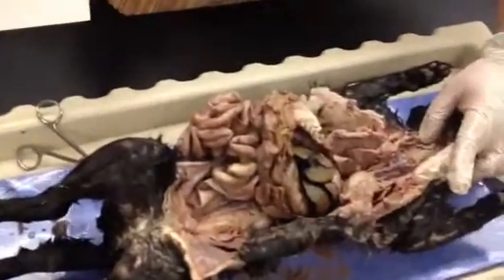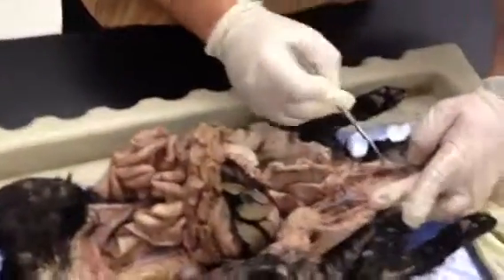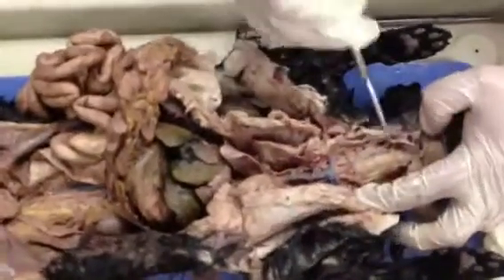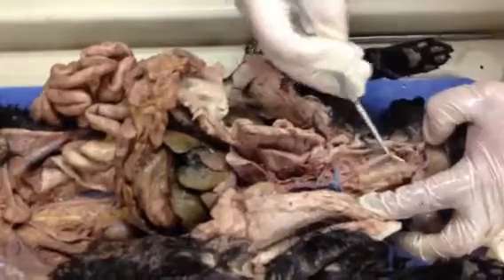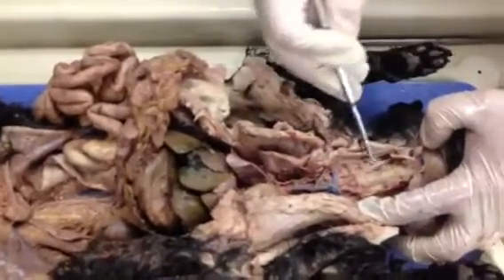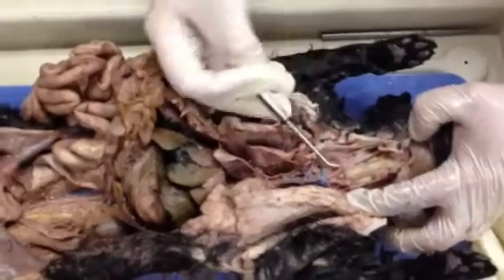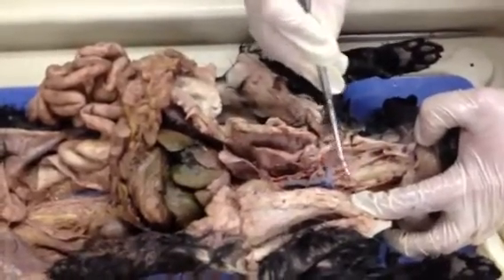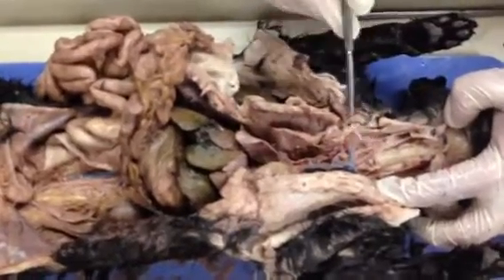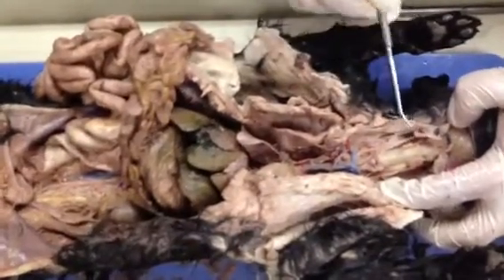All right, so this is the cat. Over here we can see the trachea with the tracheal rings, which are cartilage. If we look left and right side of the trachea, we can see the right and the left common carotid arteries. Right next to them, we can see this little nerve called the phrenic nerve, which comes from C3, C4, and C5, which goes to the diaphragm, which controls your respiration.